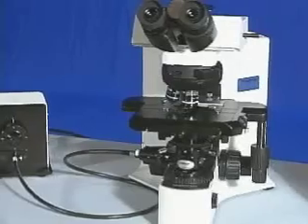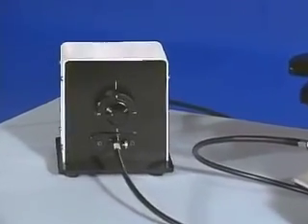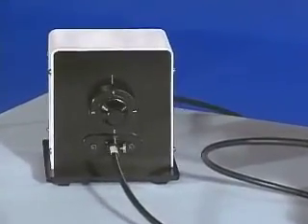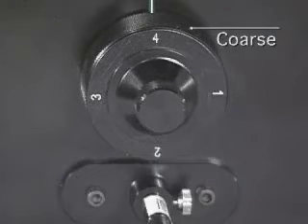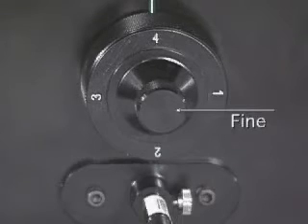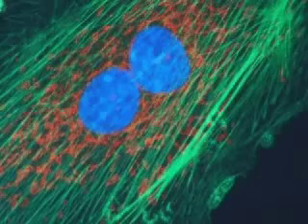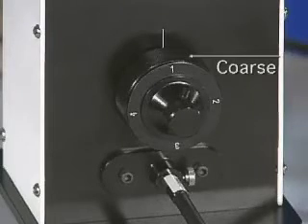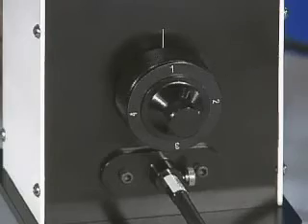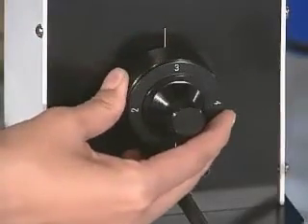Now it is time to become familiar with the fluorescence modulation unit. Identify the following features: the four filter locations, the coarse adjustment knob, and the fine adjustment knob. These numbered positions correspond to the full fluorescence mode of the filter. The coarse adjustment knob allows for the convenient selection of filters — turn the coarse knob and note the tactile sensation associated with each filter position.